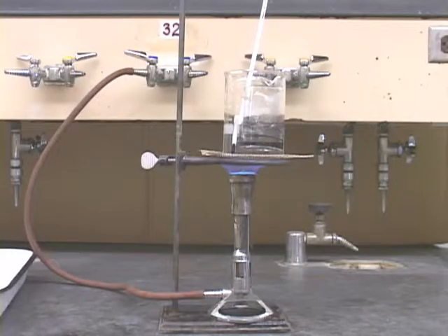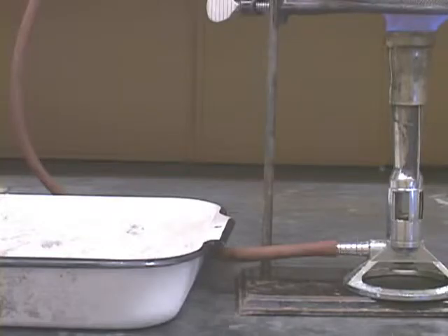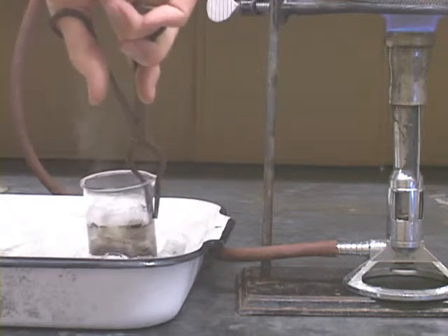To carry out this exchange, you'll put the reaction beaker in a warm water bath at about 60 degrees for 5 to 10 minutes. Do not heat too hot, otherwise you'll lose too much of the excess ammonia, which is volatile. A brownish precipitate should form. Cool the beaker to complete the precipitation of the complex.